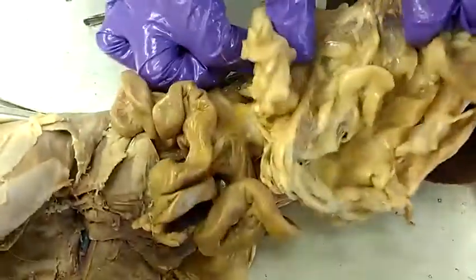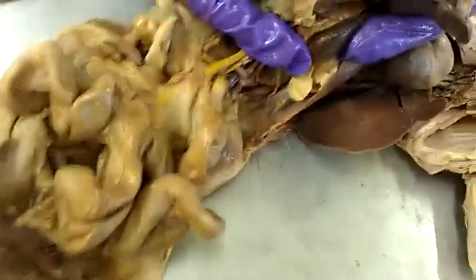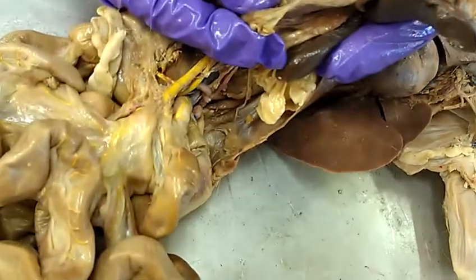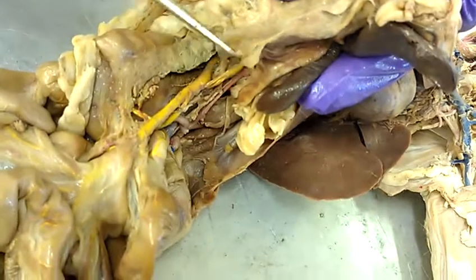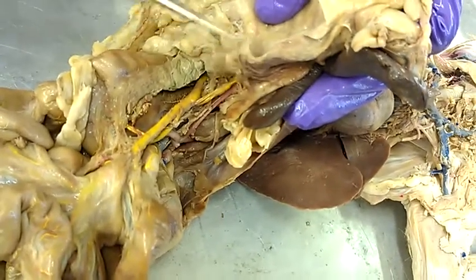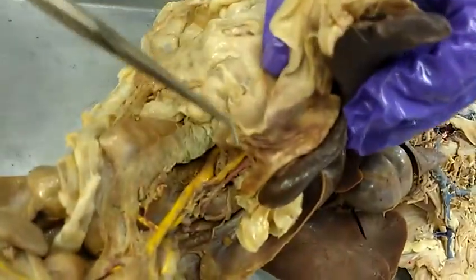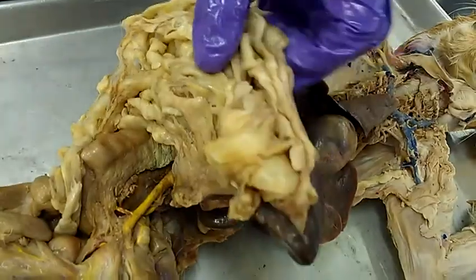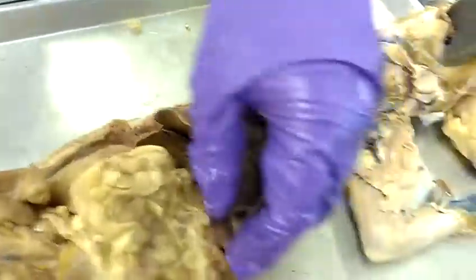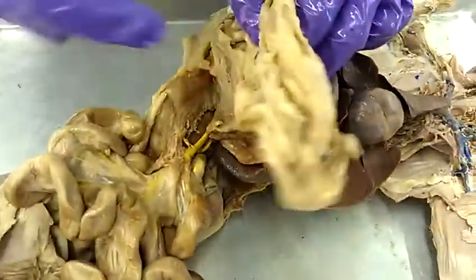Pancreas. Lift up the greater omentum and you'll find it — it's sticky. The pancreas is at the loop of the duodenum, and that's where you see the head of the pancreas.